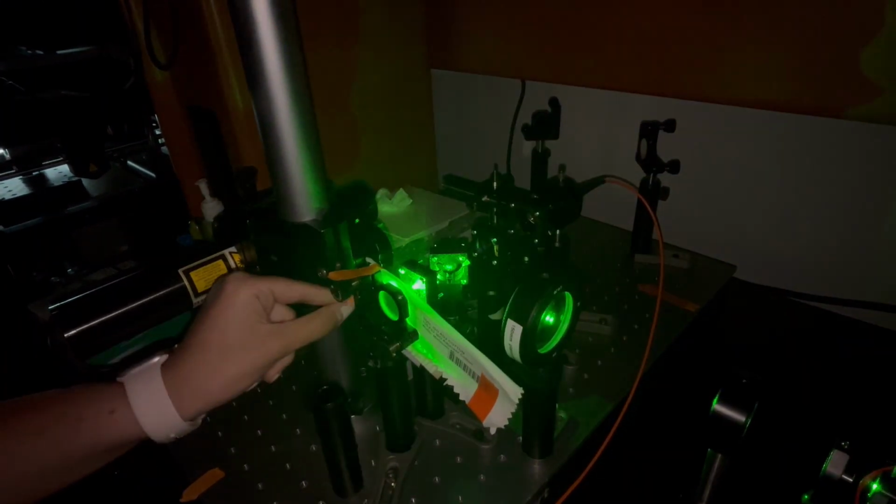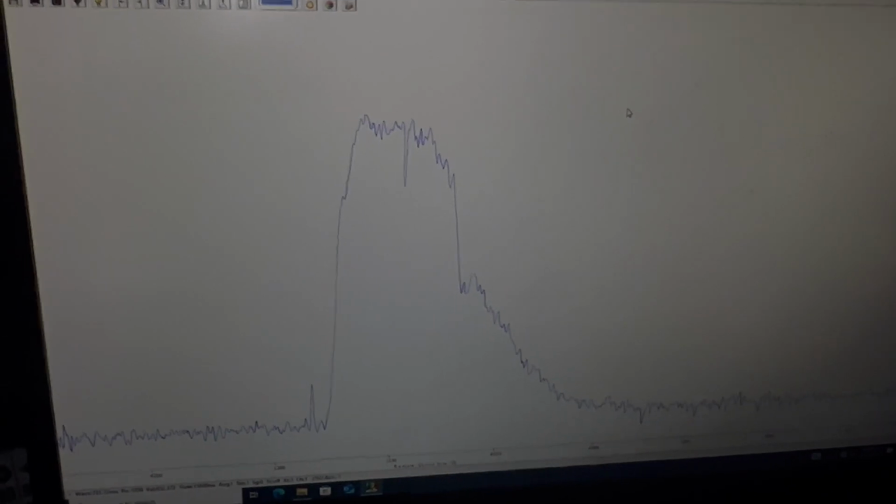Using this test setup, we collected data from an ISO-adjacent cotton sample 3 times and recorded the spectrum each time. The integration time used for each trial was 10 seconds, keeping in mind that our engineering specifications stated we should have an overall system response time of 15 seconds. For each trial, we placed the sample, let the 10-second integration time run, collected the spectrum, then removed the sample. We allowed the spectrometer to zero out before placing the sample back and beginning the next trial.